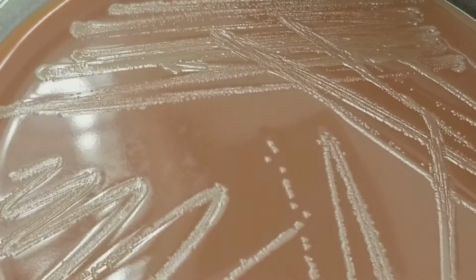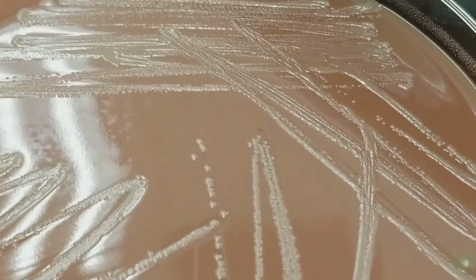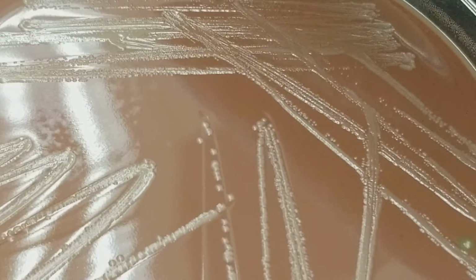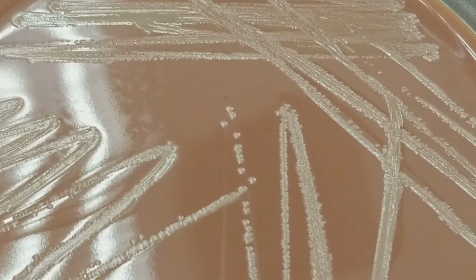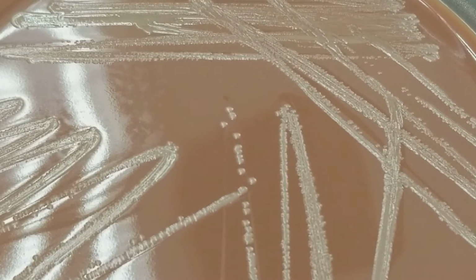And if it's influenzae, it's not going to necessarily grow. It's not going to grow on your blood agar plate. They would also do other testing. You've seen it in a different video, the X and the V testing to see what it needs in order to grow, and that helps speciate it. All right.